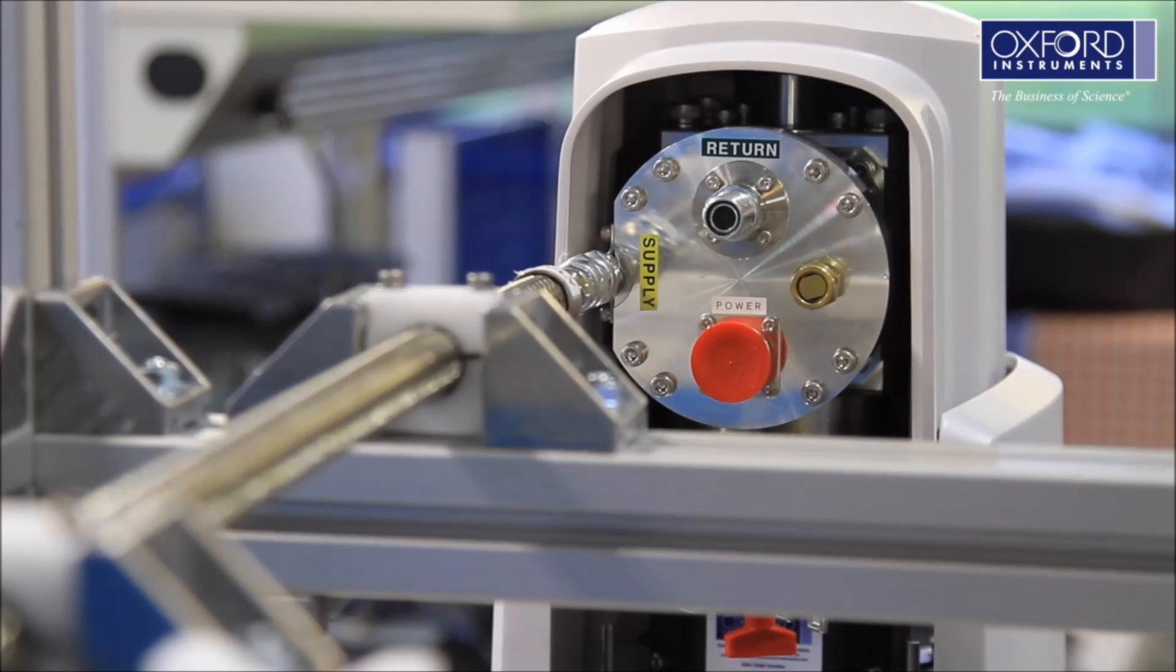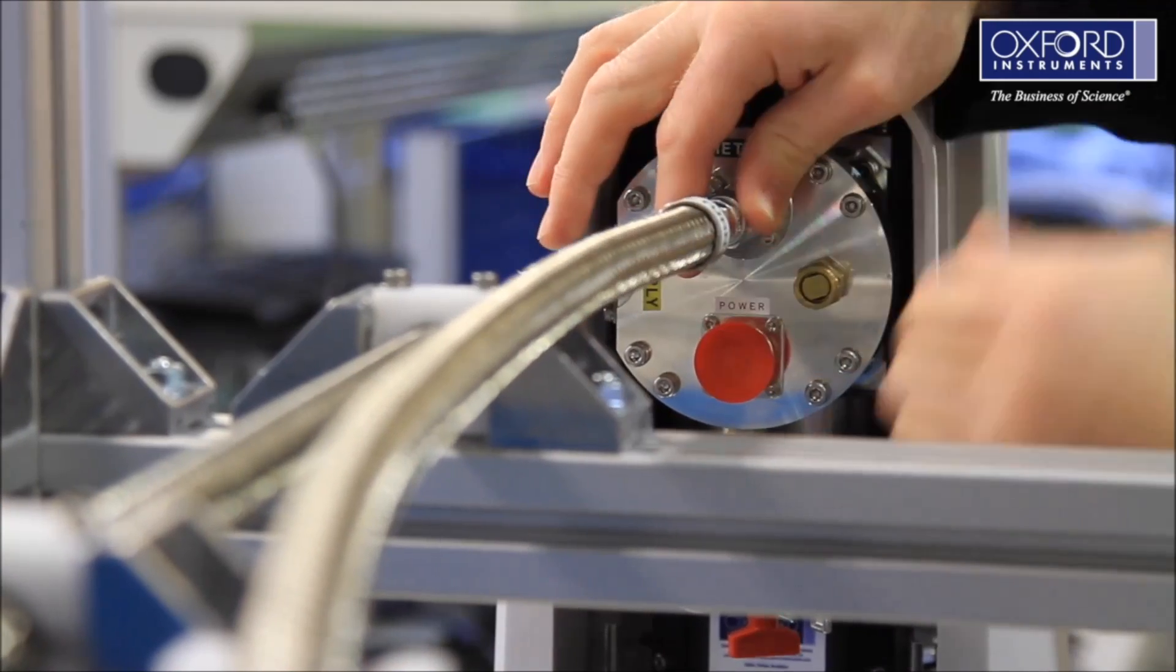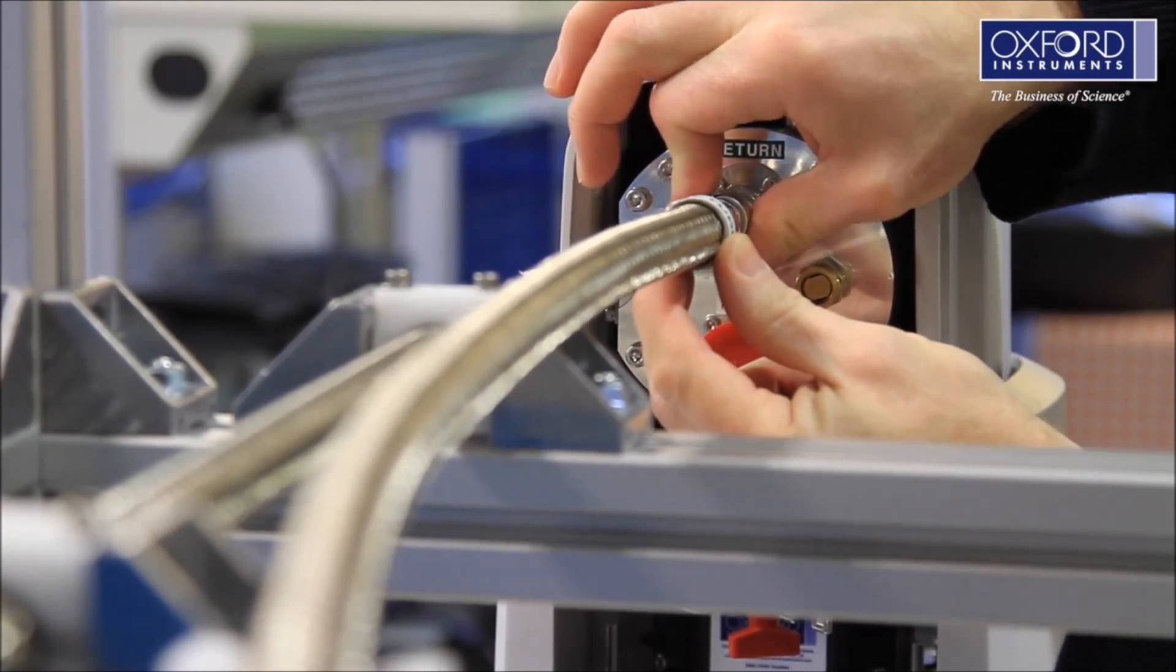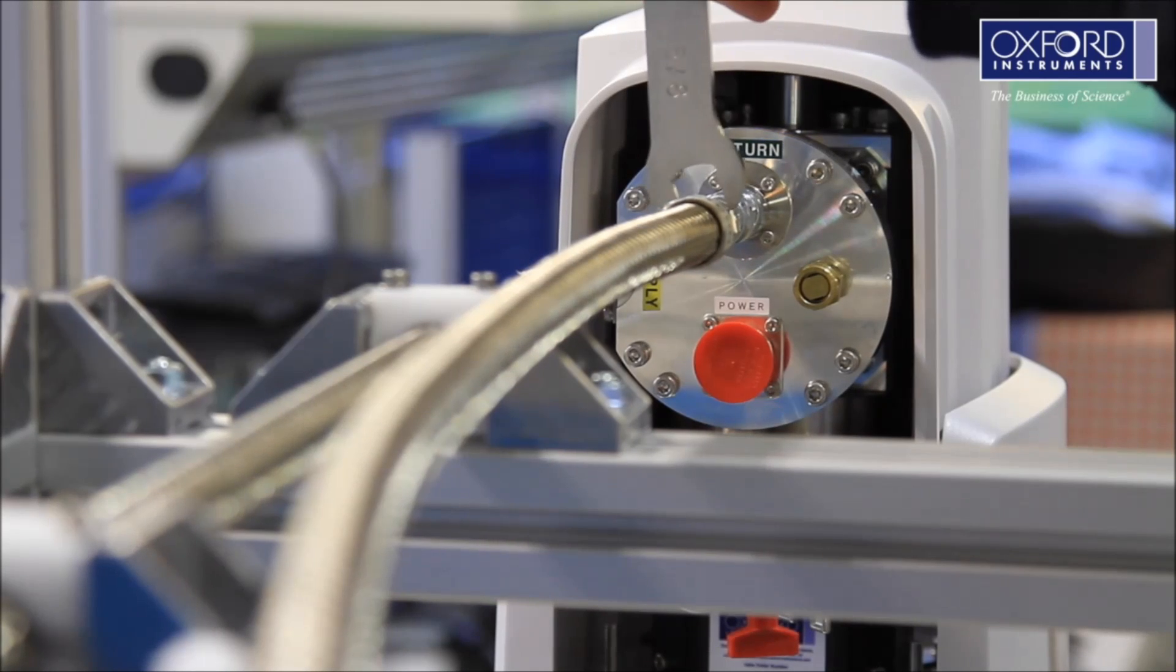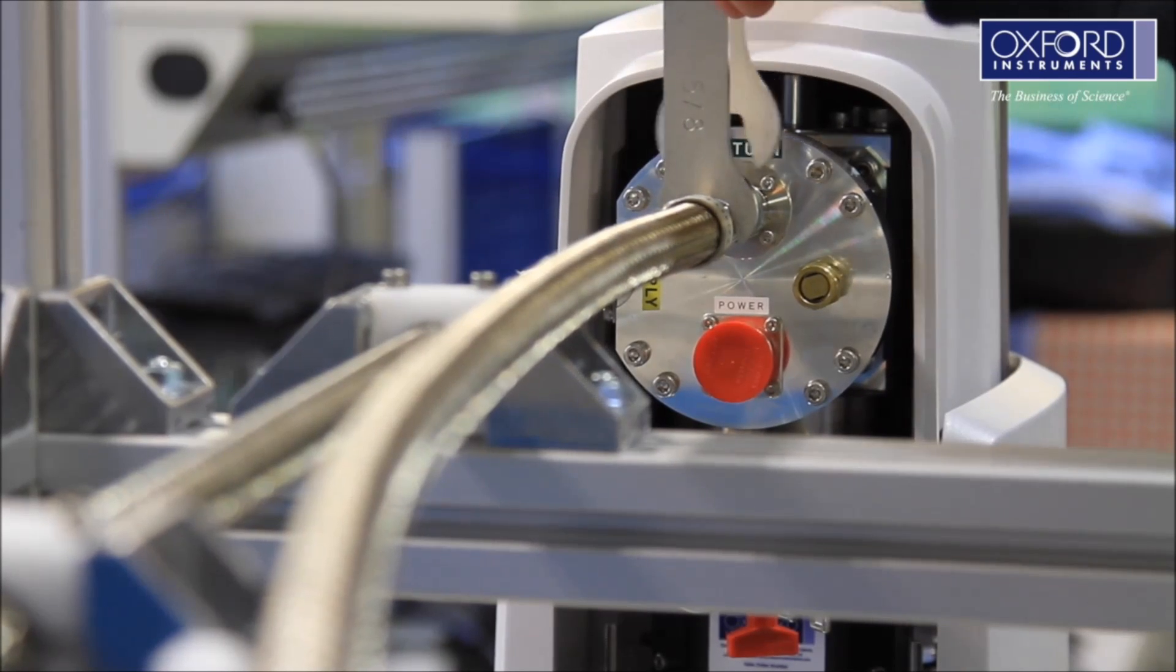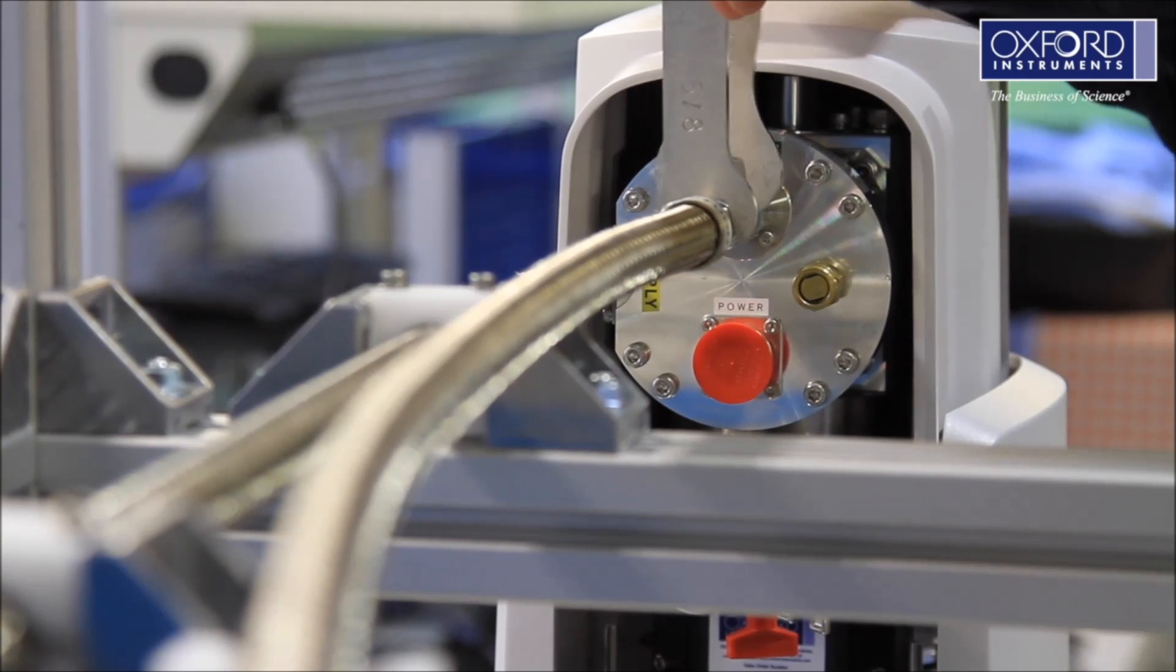Feed the helium lines to the cold head. Again, ensure you use both spanners to tighten them correctly. Make sure you connect the supply to the supply and the return to the return.